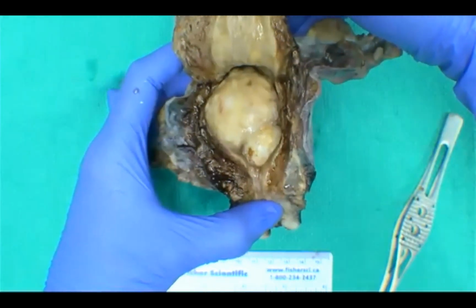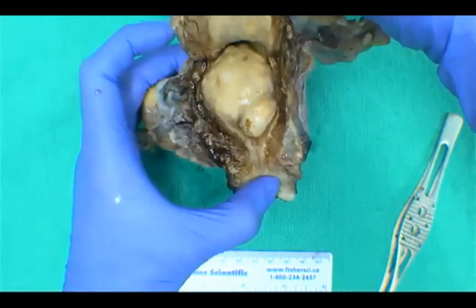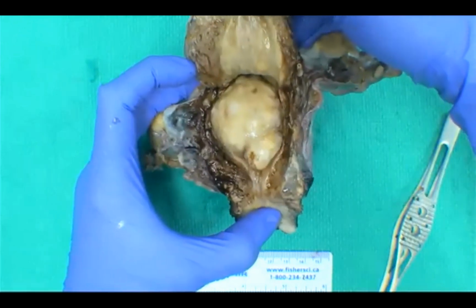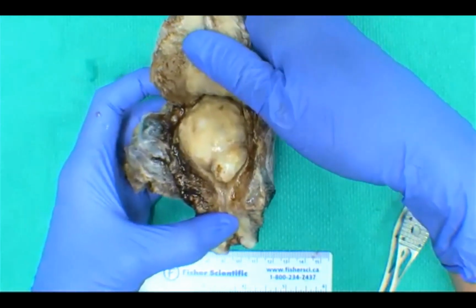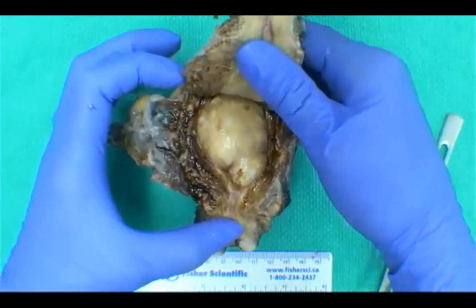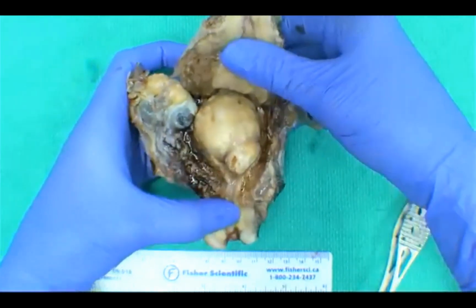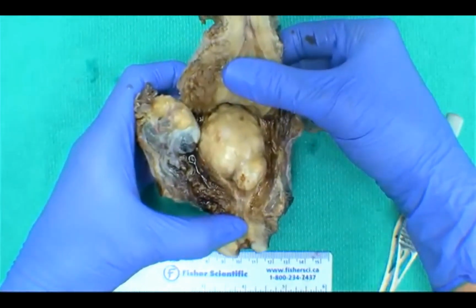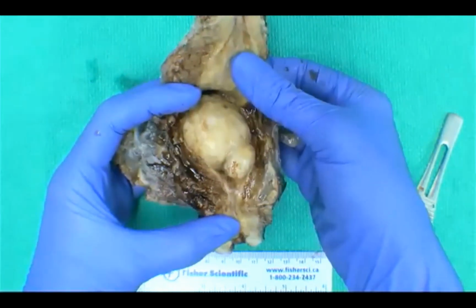Great. So I'm seeing a lot of leiomyoma here. Someone said submucosal leiomyoma. Great. Endometrial polyp. Okay, good. So we have fibroid, polyp, and endometrial carcinoma. Great. So those are the major things that we would think of if we were to see a mass within the endometrial cavity. We also have some votes for a sarcoma. Sure. And gestational trophoblastic disease even.